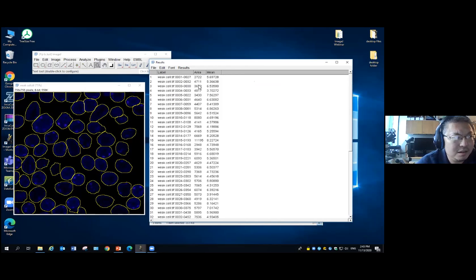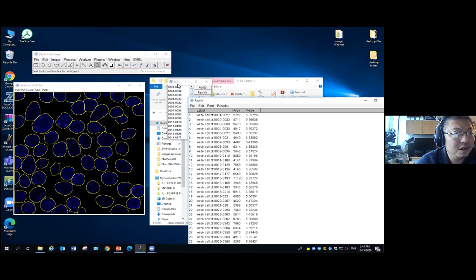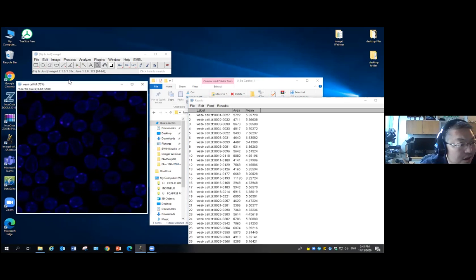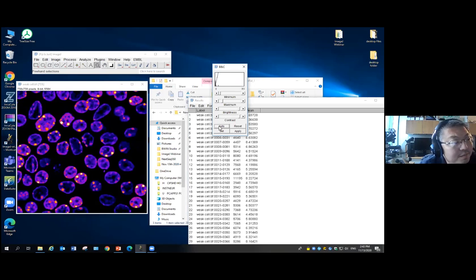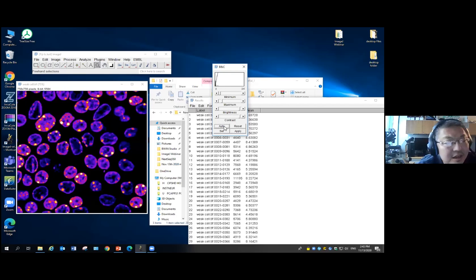So this is all my cells. We get the size, which has no pixel information here, so it's just pixel numbers. For the mean intensity, as you can see, it's pretty low, only like 5 or 6. But sometimes when you try to process the image, I can use Adjust to make the image look better, like a higher contrast, to help me identify the cells, even if I want to manually draw the selections. You can adjust the contrast and everything; it doesn't really affect your measurement.